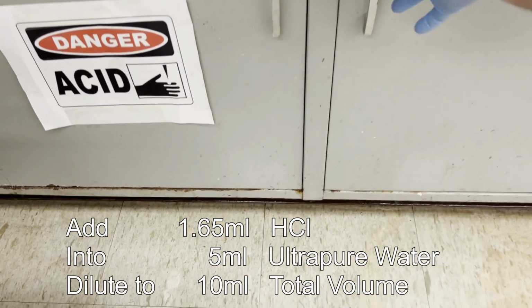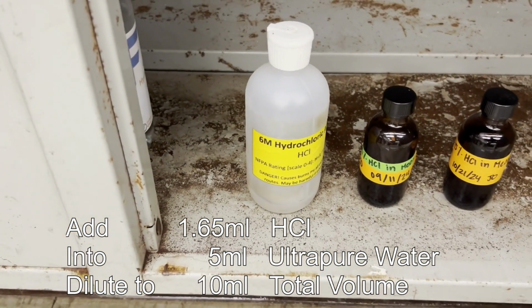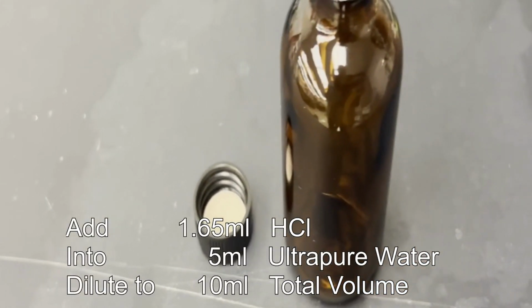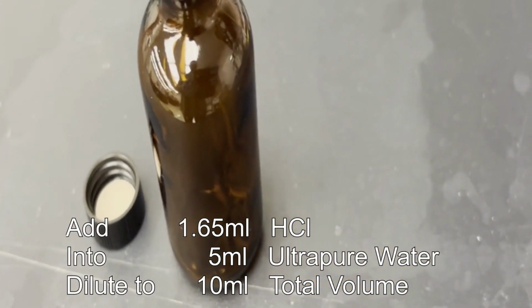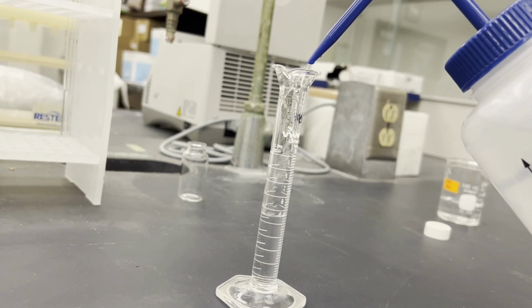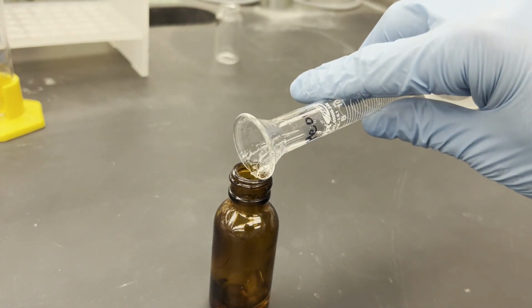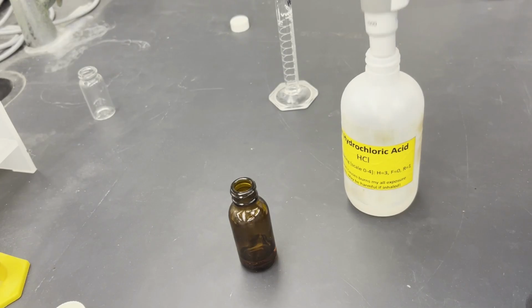Next, we will be preparing our hydrochloric acid, which is used to neutralize our samples after derivatization and quench the reaction. We're using 6 molar hydrochloric and we'll be adding it to a chem-safe bottle. Start by adding 5 milliliters of ultrapure water to the bottle, as adding water to the acid will generate heat and it's best to be safe. Then we add our acid.